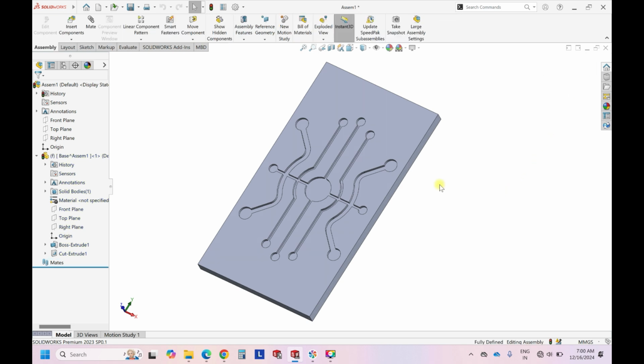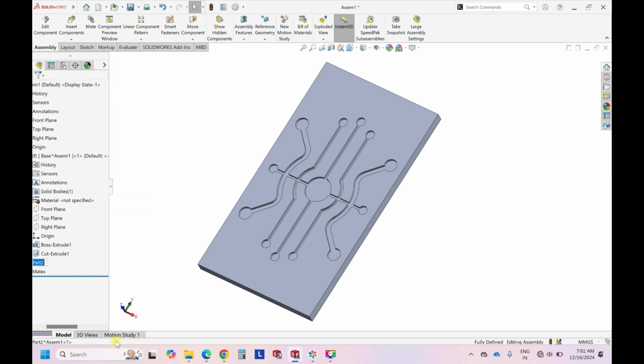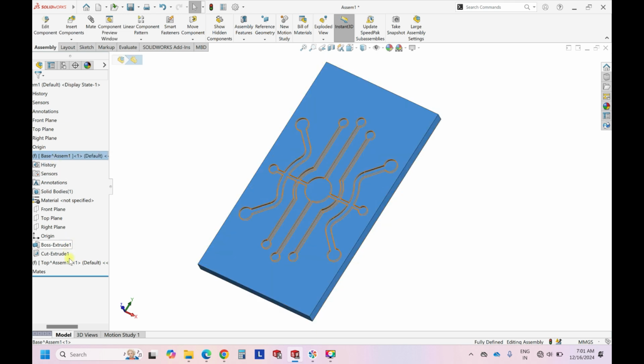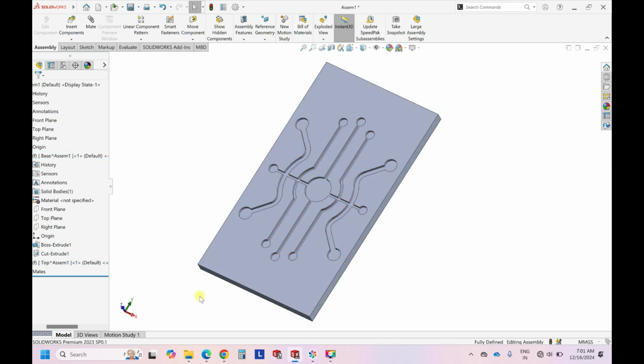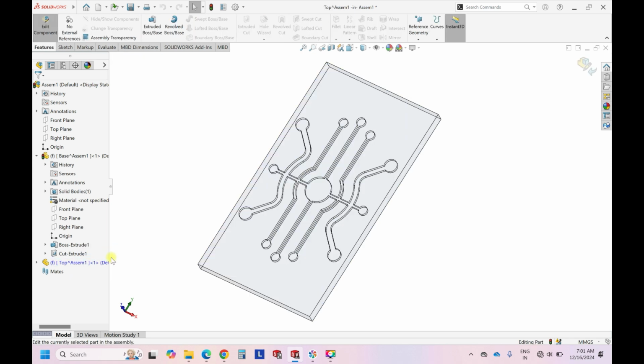So come out of the part, and since it is 3D printing, we need a closure from the top so that the liquid is constrained inside. So create a new part, click on the screen, and rename it as top. Initially I renamed the first as base, and the next is the top that we are going to design. Again, the same way as I told, click on this and edit this part so that we can edit inside this inserted part.